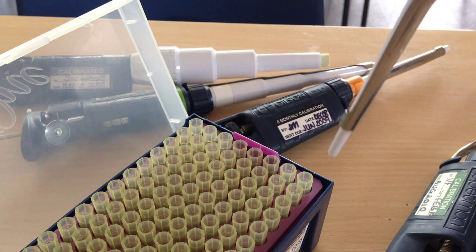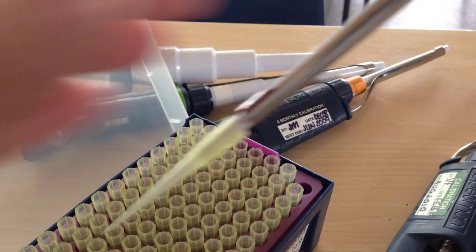So you need to hold the Gilson steady and just add the tip on there with a nice firm movement like that.